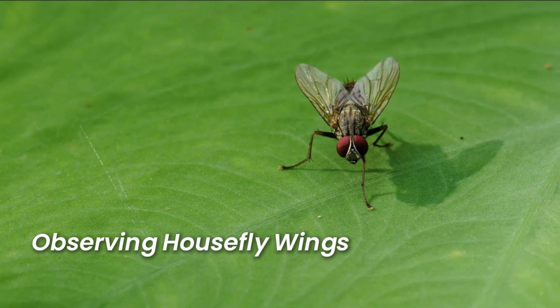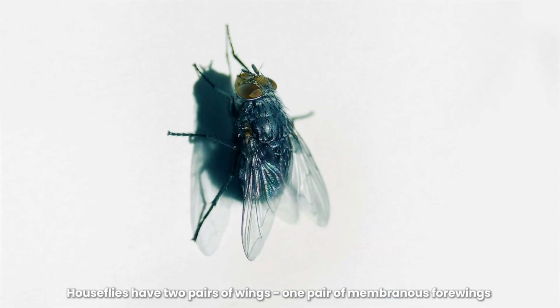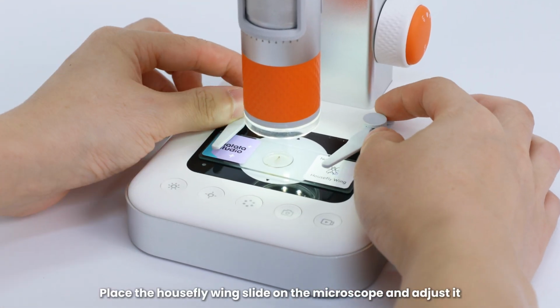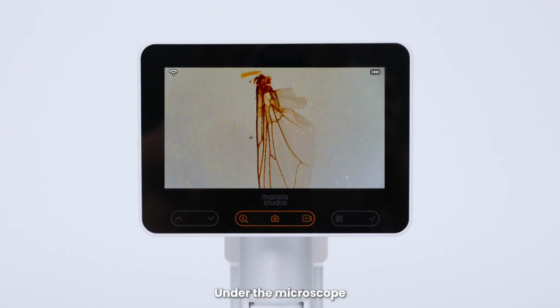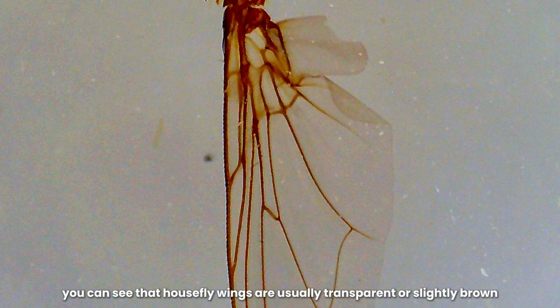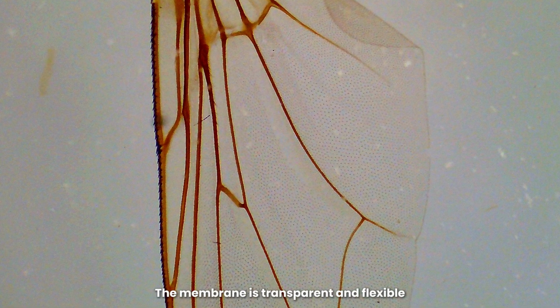Observing housefly wings. Houseflies have two pairs of wings, one pair of membranous forewings and one pair of halteres. Place the housefly wing slide on the microscope and adjust it. Under the microscope, you can see that housefly wings are usually transparent or slightly brown, with thick and visible veins. The membrane is transparent and flexible.